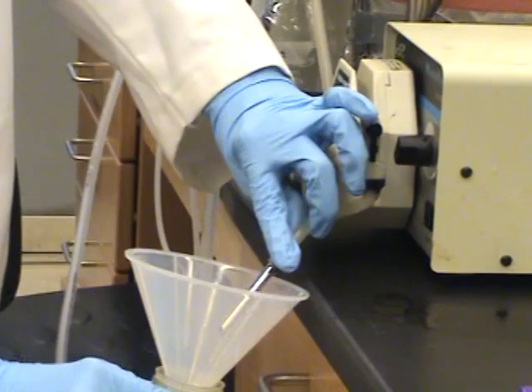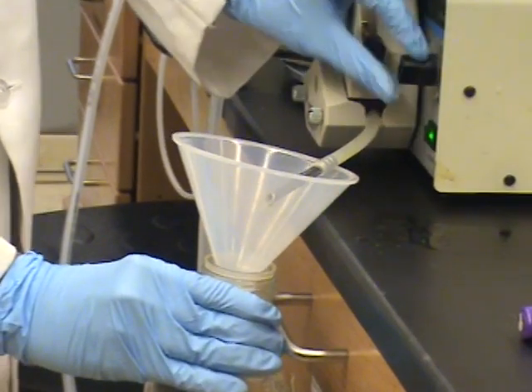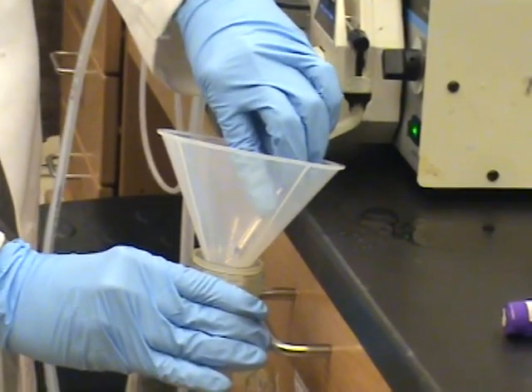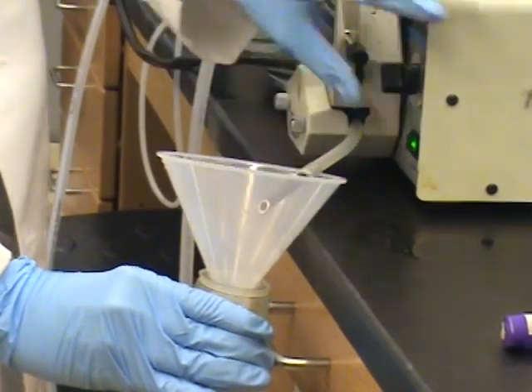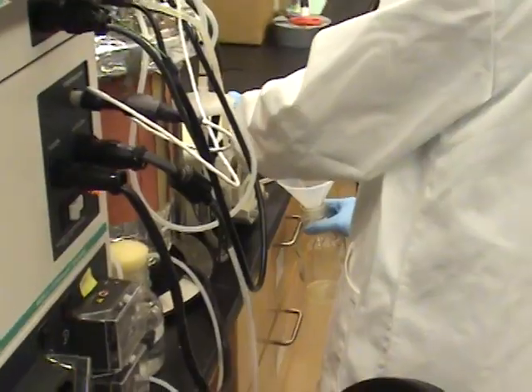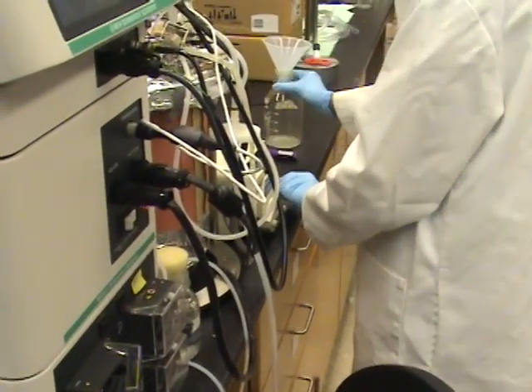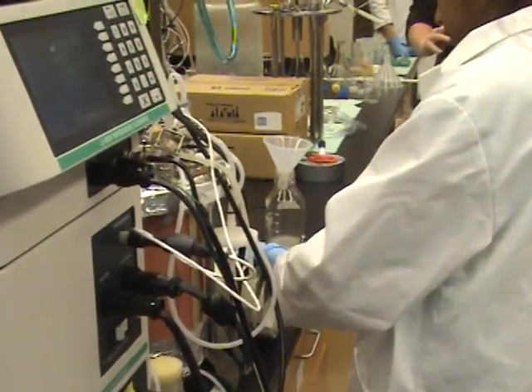Drain the remaining sample from the tube into the waste container. Keep pumping until the tube is clear. Wrap up the remaining tubing.